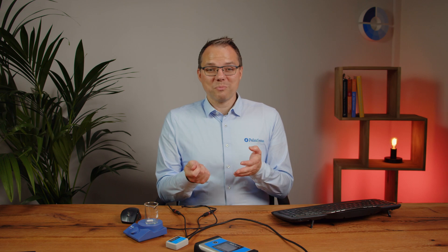There are two ways of stripping voltammetry that are common. One is to take your electrode and rub it on the material you would like to analyze — this is mainly qualitative. As an electrochemist, the way I usually do it is the other one: electro-depositing the material on my electrode. That means you apply a very cathodic potential for a defined amount of time, accumulating for example heavy metals from a solution. The heavy metal ions get reduced when they contact the cathodically polarized electrode, and you choose an electrode where these metals stick well.